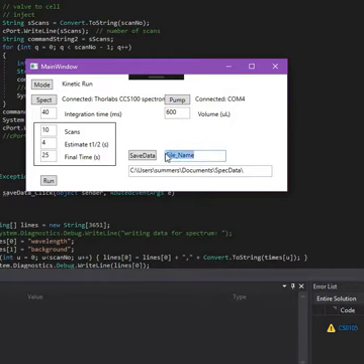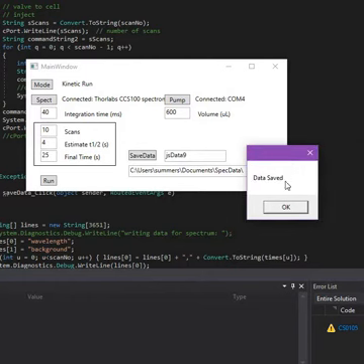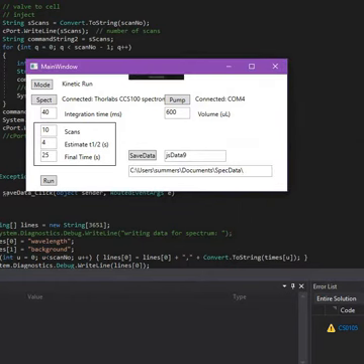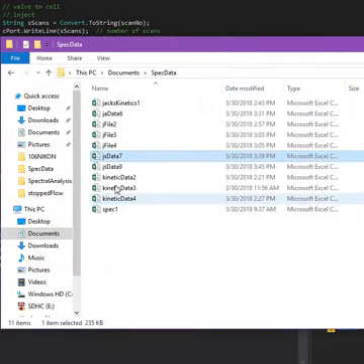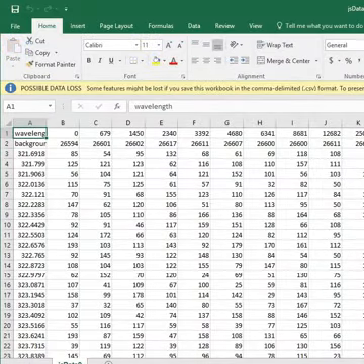Now we're going to save the data. Let's call this JS Data 9. That's going to save to this path down here, Summers, Documents, Spec Data, JS Data 9. So we hit the Data Save button. It says over here that the data has been saved. And now we can find JS Data 9, double click on it, and open it up in Excel.